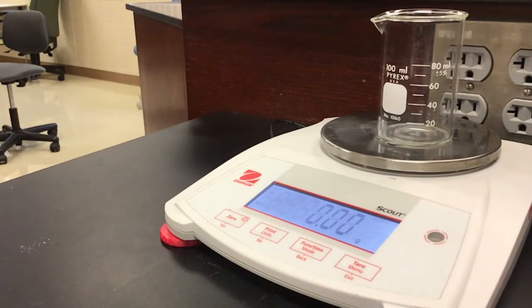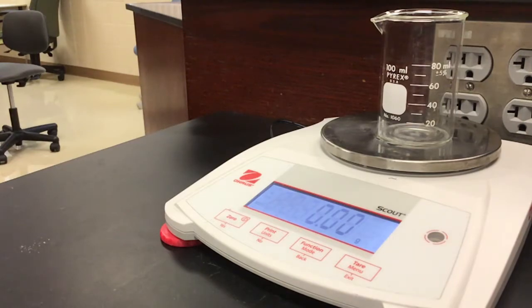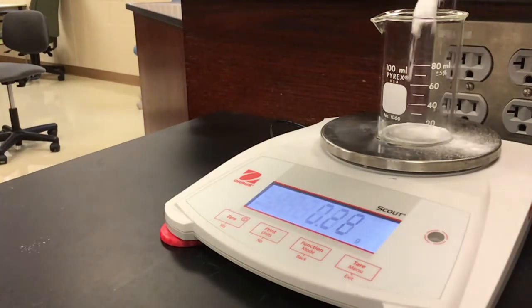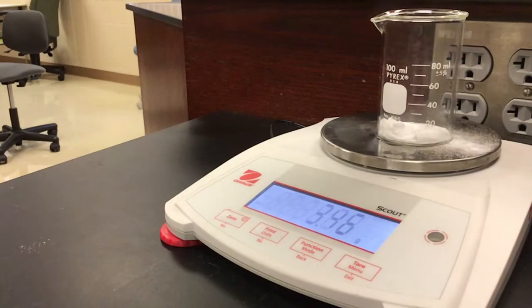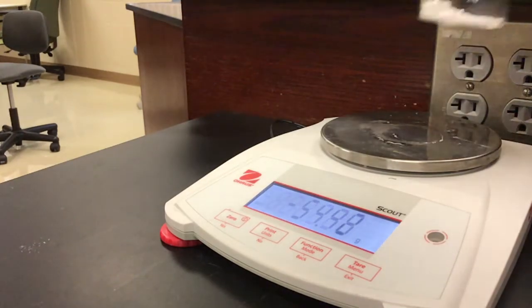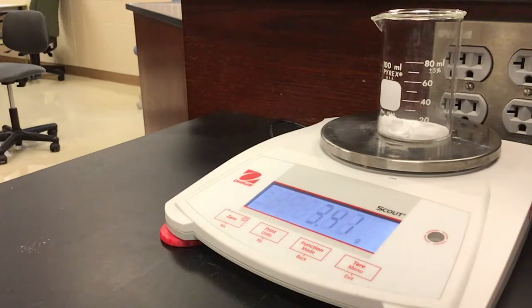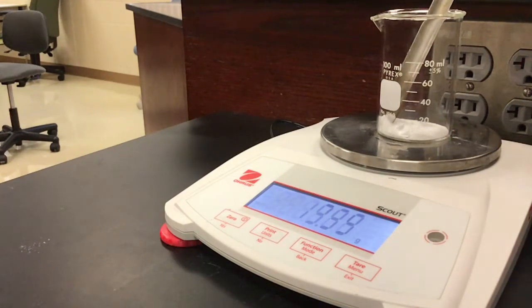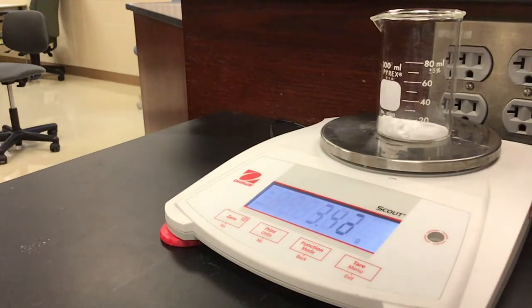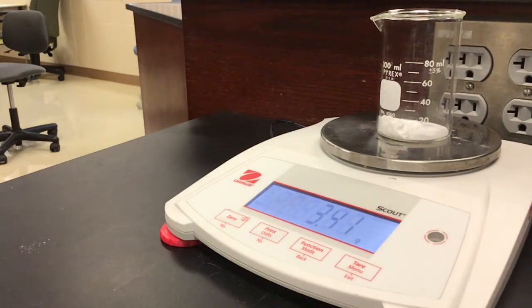I'm going to measure out two grams of salt. I used a different salt instead of NaCl. Let's just use that amount: 3.41 grams. Perfect.